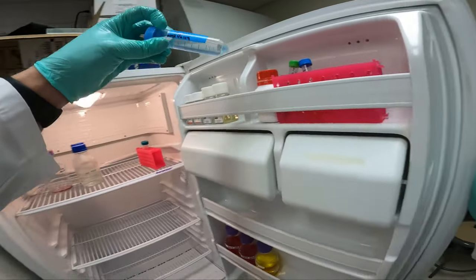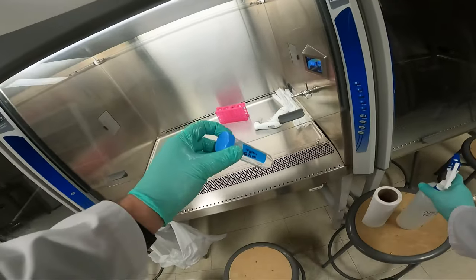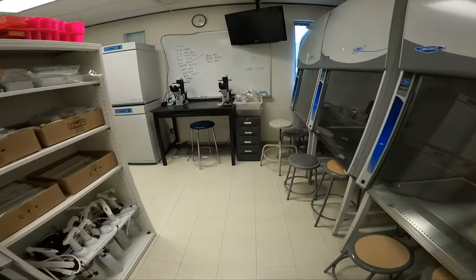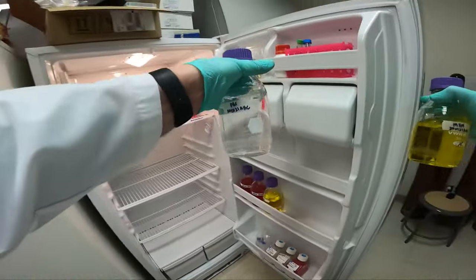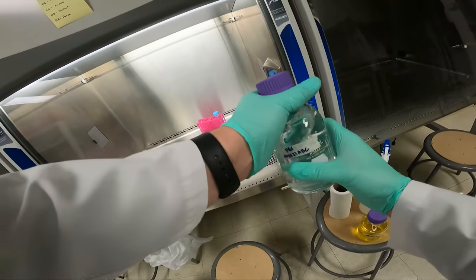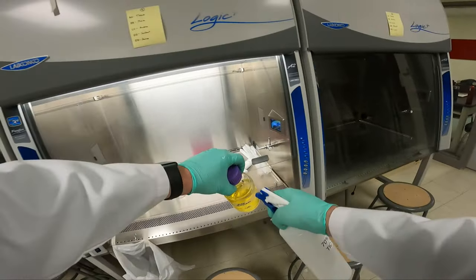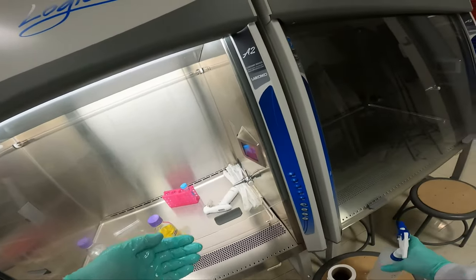Our solutions are kept in the fridge. We'll need some trypsin — it's in a 50 ml conical tube. This was prepared in an earlier lab in PBS and EDTA, then filter sterilized. We'll also need some PBS and some MEM. Note this MEM is not finalized yet — this is just for demonstration purposes. When you spray the glass bottle, it can be very slippery. Make sure you don't drop it by holding it with an eagle claw talon grip on the cap. It'd be a shame to have to make a whole new bottle of MEM because it slipped out of your hand.